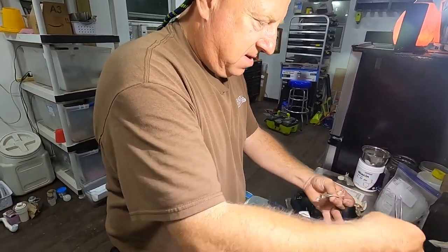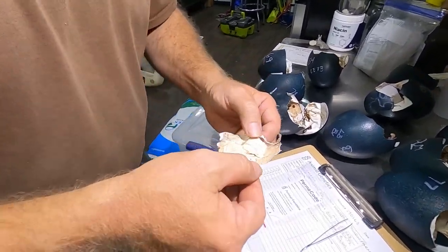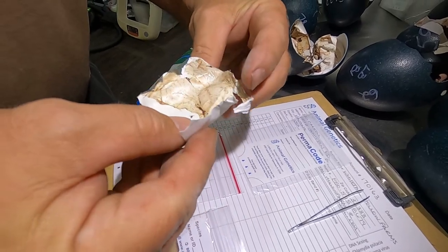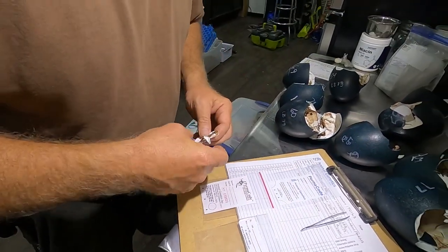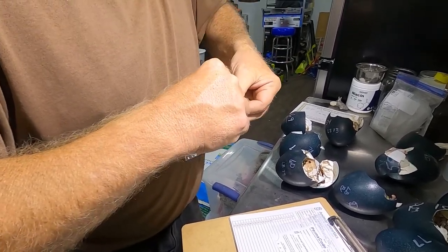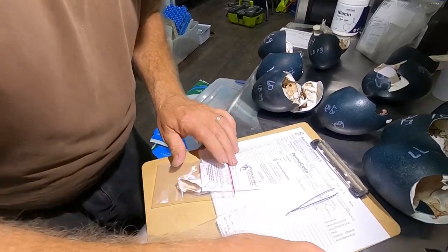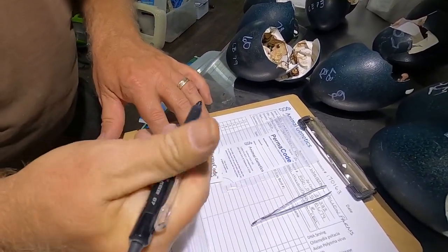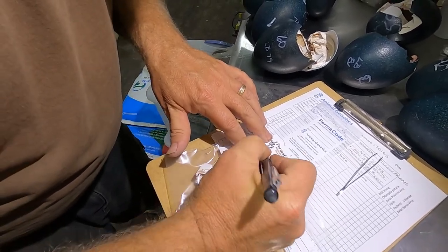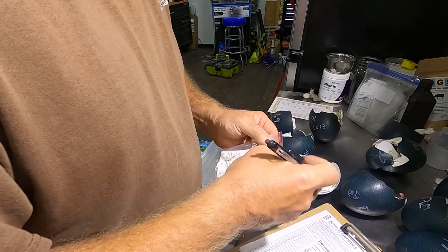We got our chunk out of that one — that's leg band 77, which is what we're working with here. Let's make sure we've got some veins. I see a fair amount of veins here and there and everywhere, so I think this sample will probably work. I usually just fold it up and stick it inside the plastic baggie, then pull this piece up so I can write on it, and I tell them this is an emu. I slide that back into the envelope and seal it up.